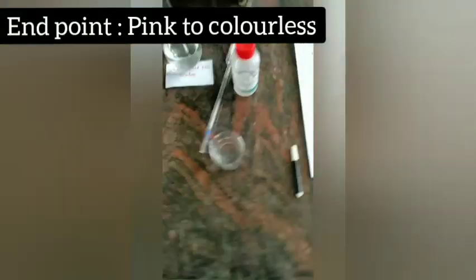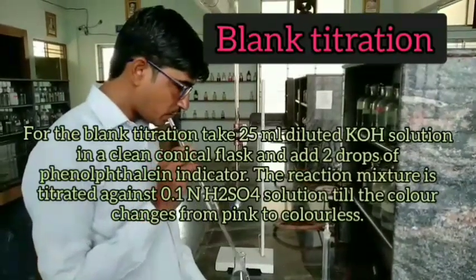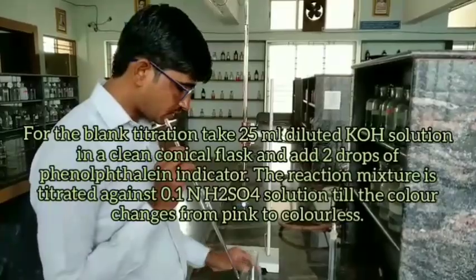The indicator used for the blank titration is phenolphthalein. The color change is from pink to colorless. This is the conical flask and here we have the 25 ml diluted KOH solution. Here we have the phenolphthalein indicator, this is the pipette, and in the burette I have filled 0.1N H2SO4 solution.